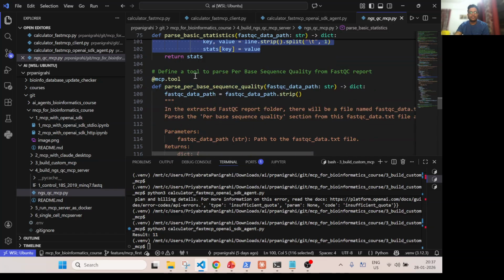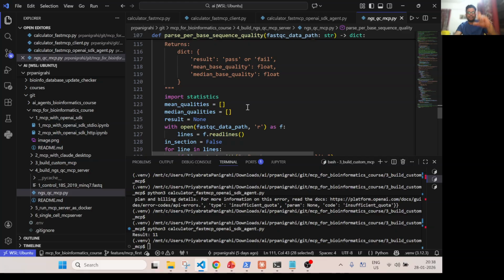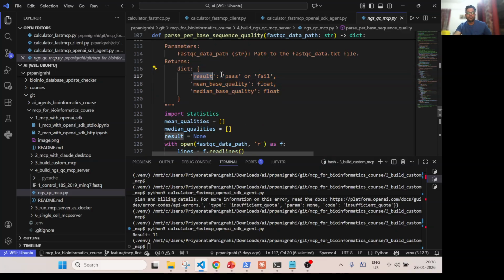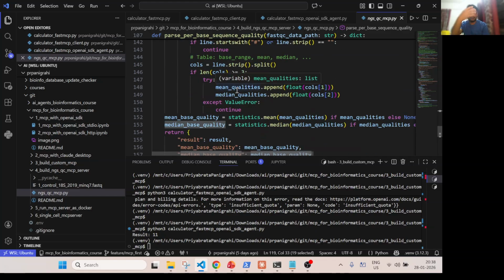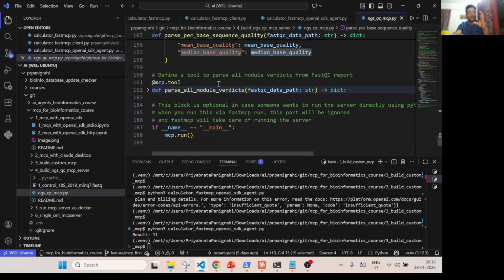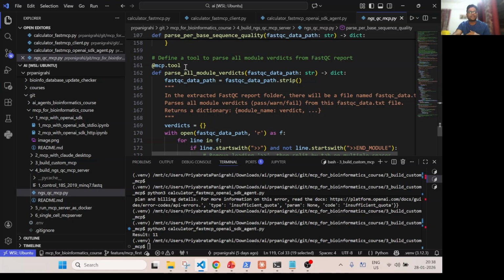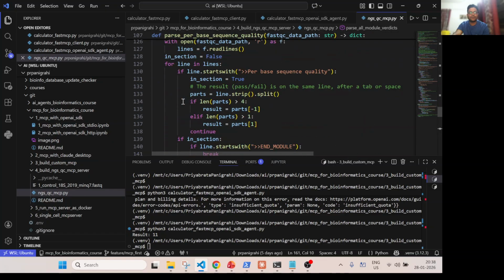Again, this function will take the same file. Again I'm telling that in the extracted folder there will be a file called fastqc_data.txt, and it parses the base sequence quality information from that file. That's a very simple text file, and it will give me an output like this: what is the overall result, pass or fail, what is the mean base quality, and what is the median base quality. This is a simple Python function, and you can generate it with help from ChatGPT as well. Very simple, but you have to understand the concept, like how I'm defining the functions here and converting them by decorating with mcp.tool.